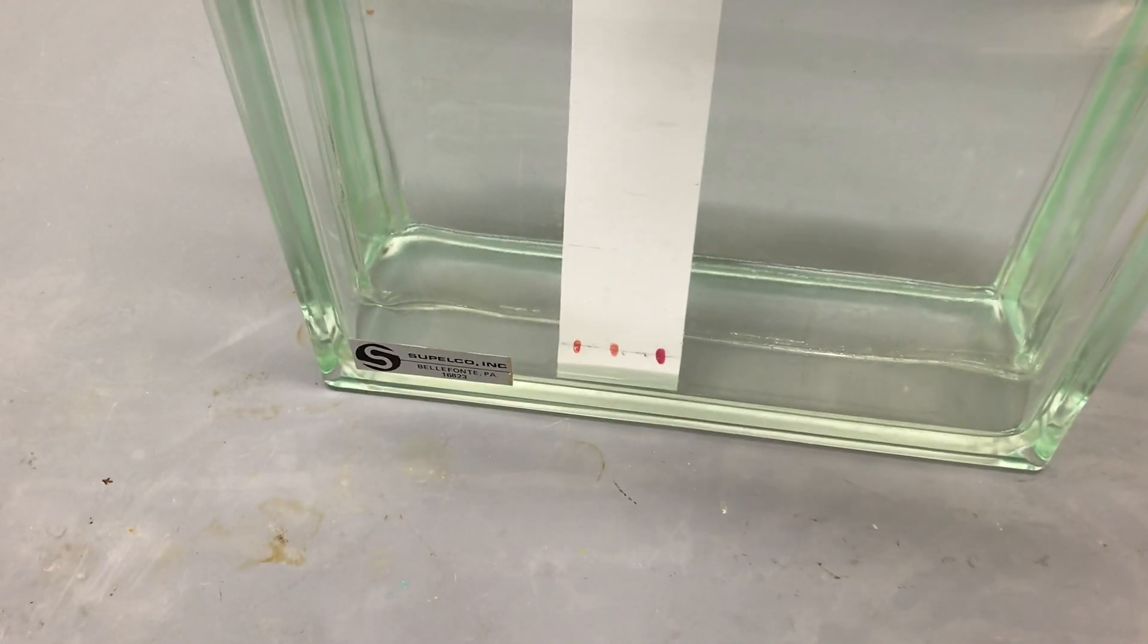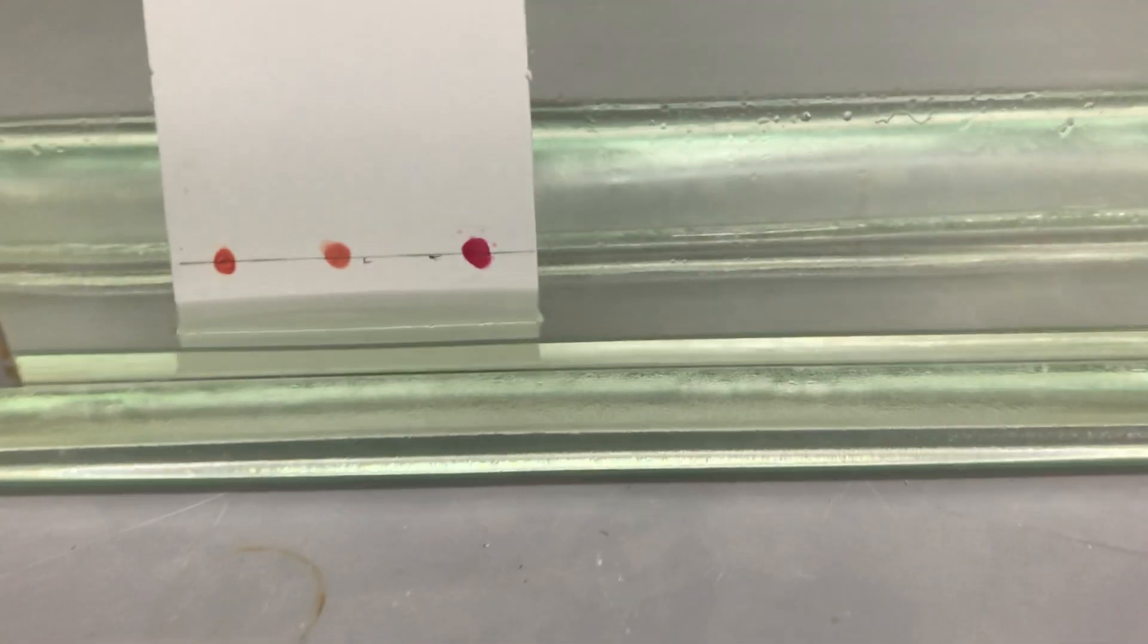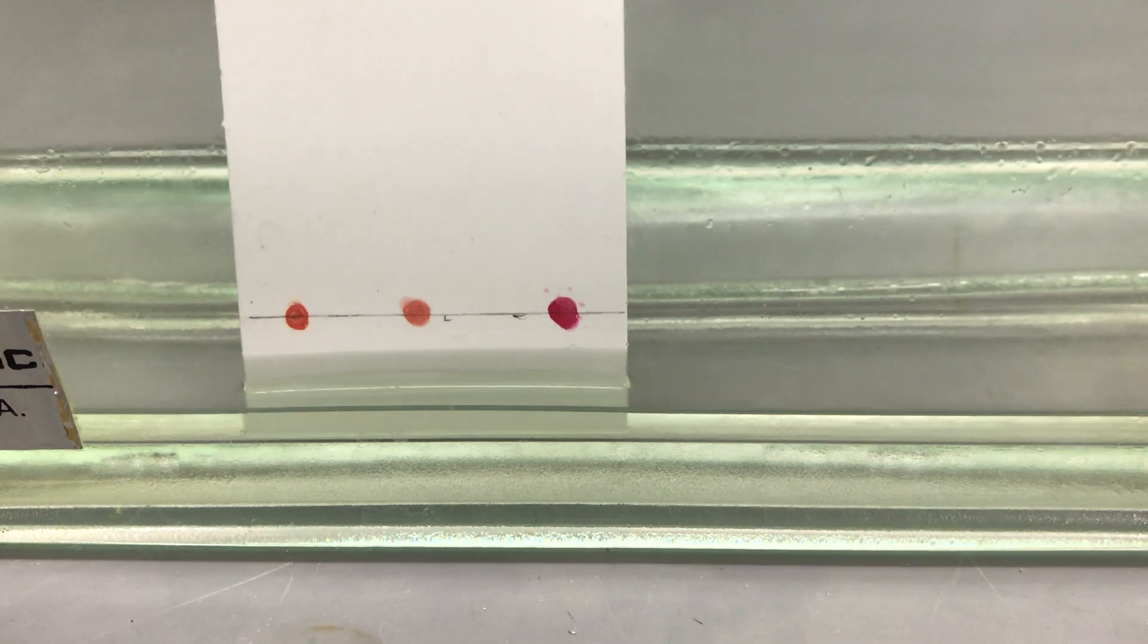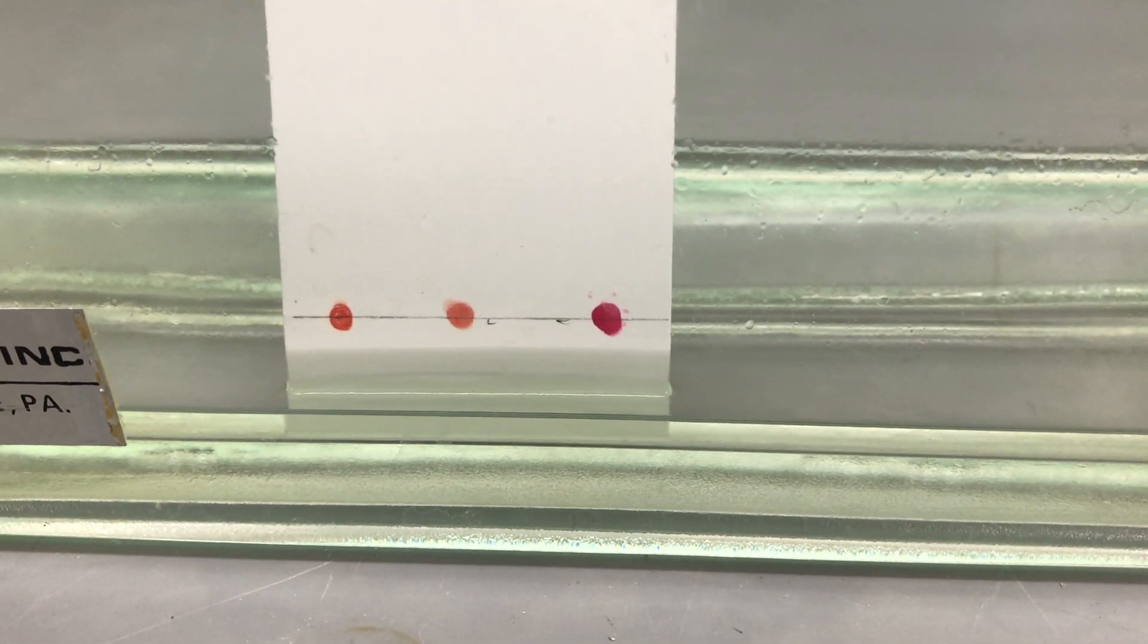And we're just going to place this on top. And let's take a closer look here, and you can see the solvent is already starting to move up the face of the plate.